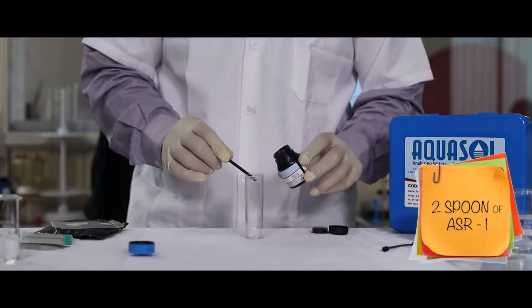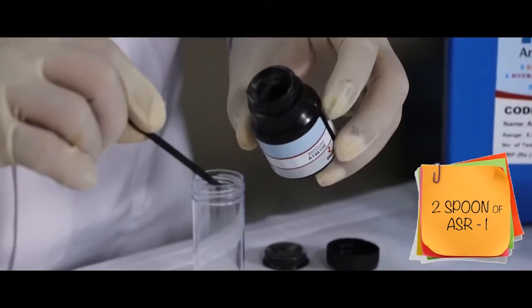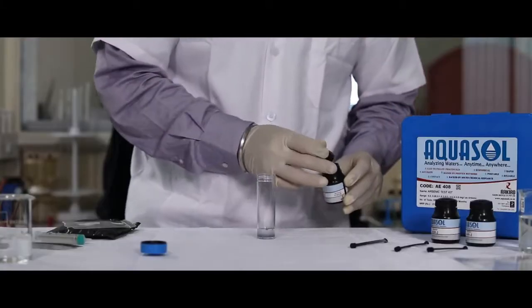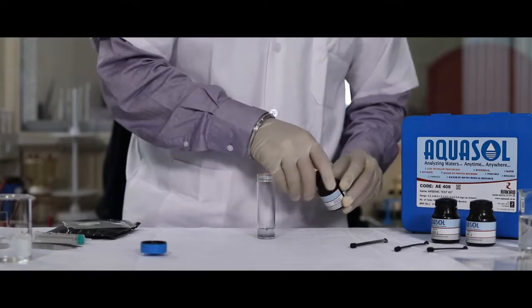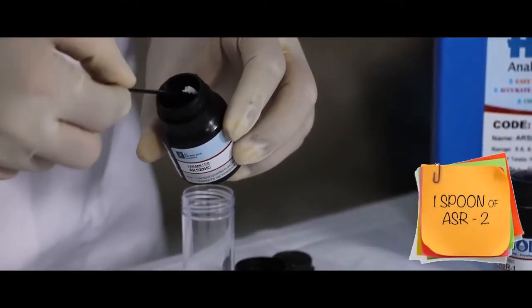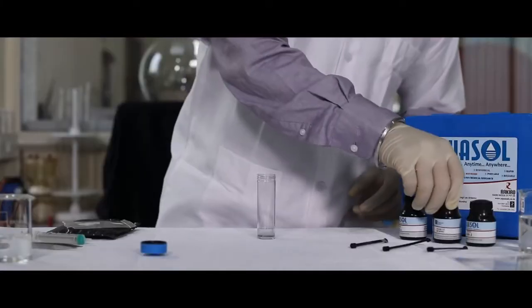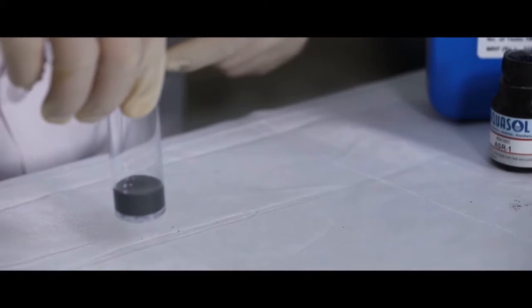Now add 2 spoonful of ASR 1 and 1 spoonful of ASR 2. Swirl the contents for a minute.